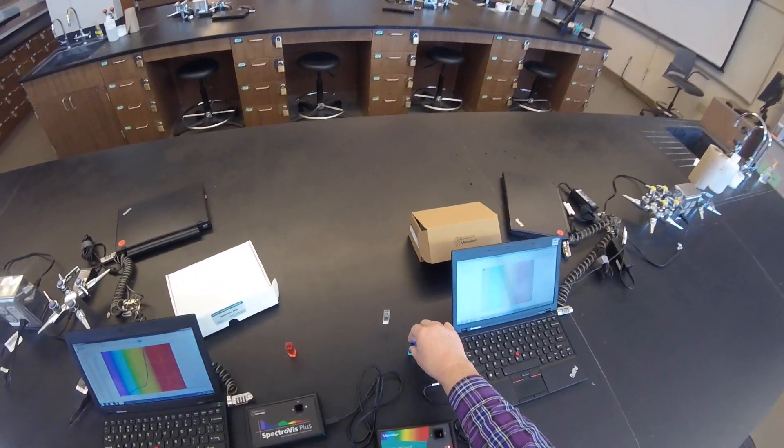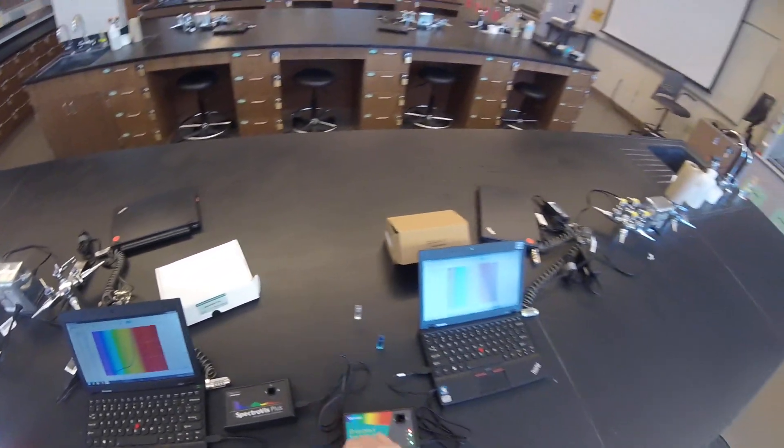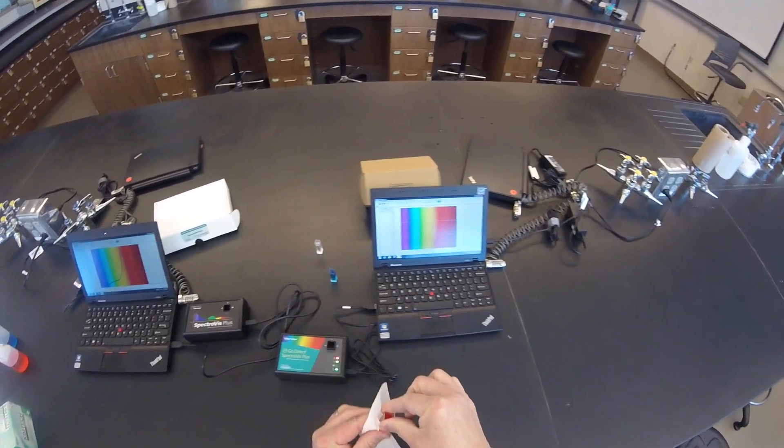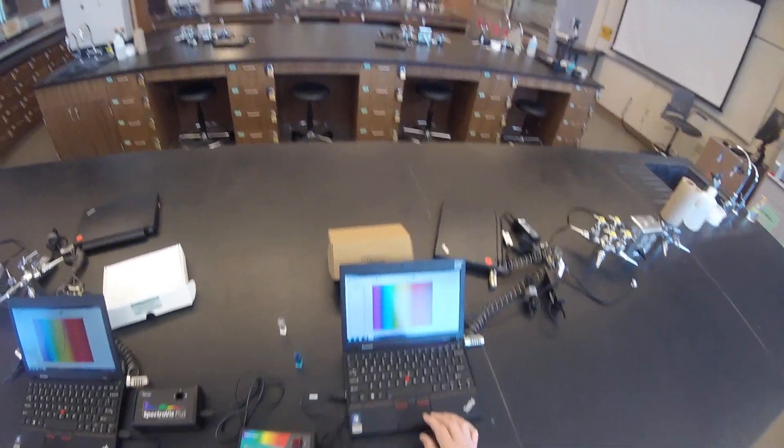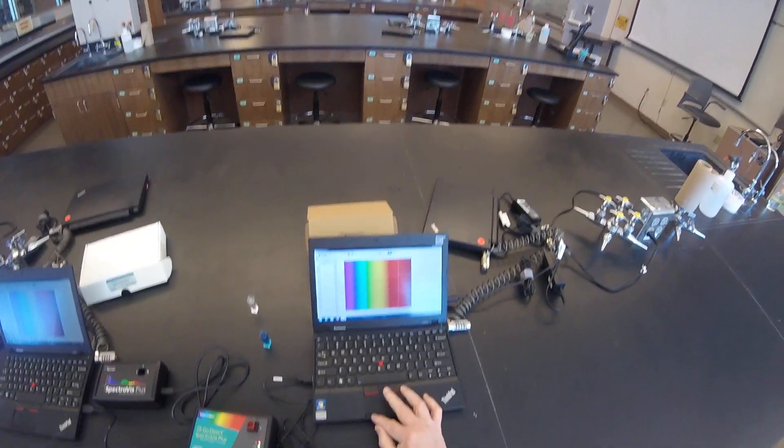Let's go on over to the GoDirect. Again, we'll take the red, pop it in its cell holder, click Collect.